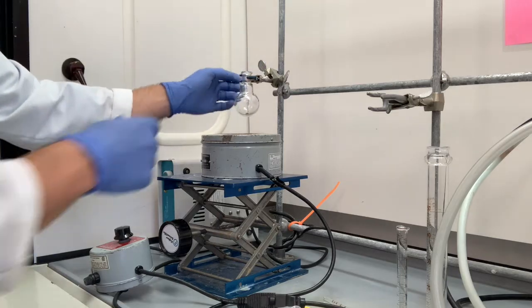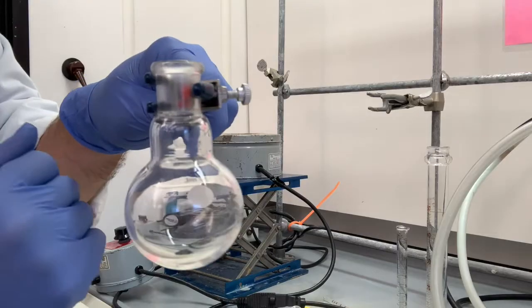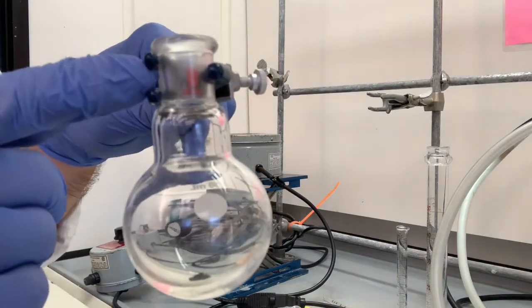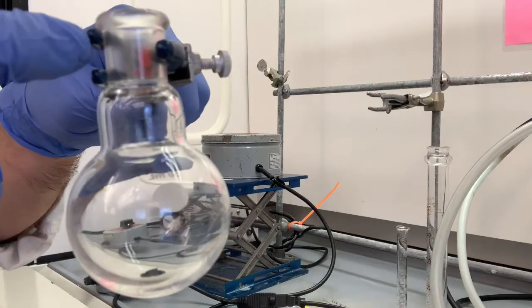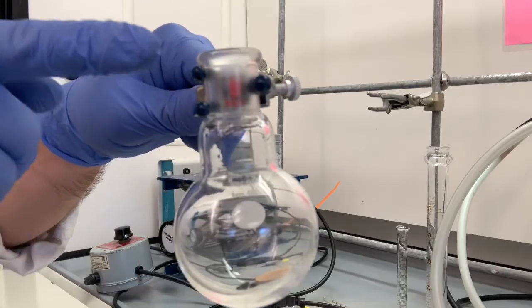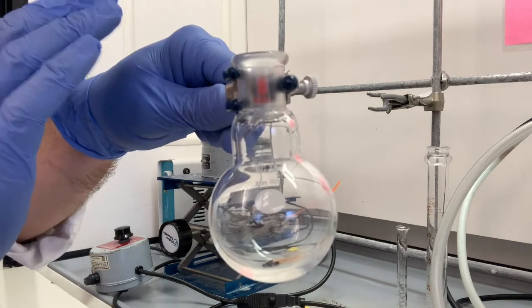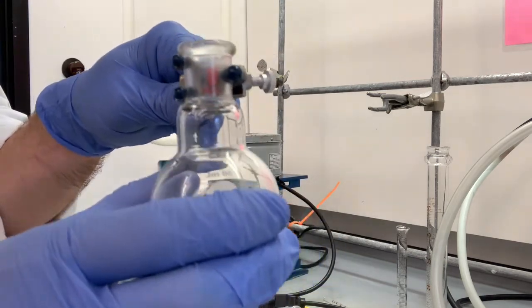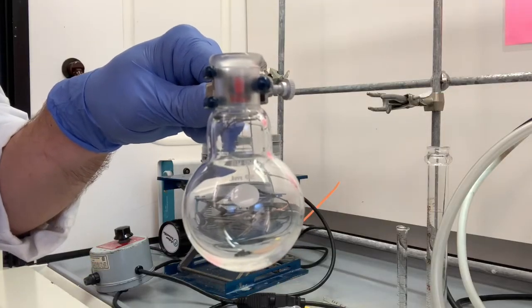So this is connected right here, and I'm going to take this out to show you. It's extremely important that it's connected with a small three-finger clamp where this finger of the clamp is directly under the lip of the flask. You don't want to have this connected any other way or it won't be stable. This right here is the stable way to connect that flask to a clamp.